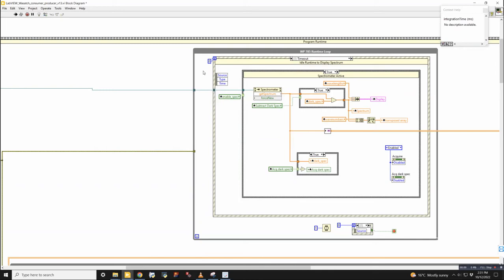Actually, those things that we put here, the transpose array and also the spectrum, are just for checking. At the end of the day, I will remove all of them. They're just there to make sure that they're getting the spectrum.